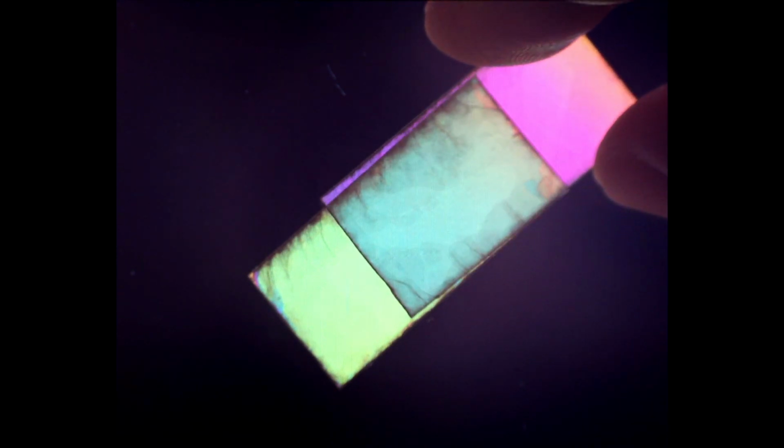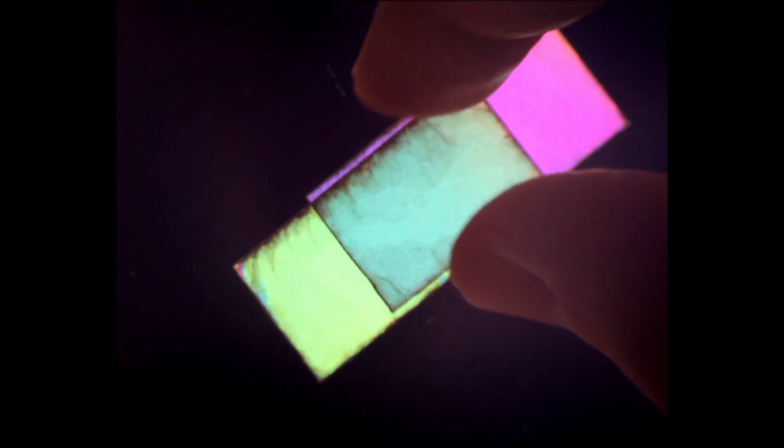But before we do that, let's also take a look at what happens when we orient our muscovite plates parallel to one another. Here, our light green and purple interference colors become a dark green where our plates overlap. So far, not as strange as the behavior we saw when our plates were perpendicular to one another. Now let's bring in our converging lens in order to check out the interference figures in this view. Once again, where our plates do not overlap, there isn't any change in our interference figure. And where our plates do overlap, things become a bit more complicated. However, this interference figure that we see will actually be fairly simple to explain.